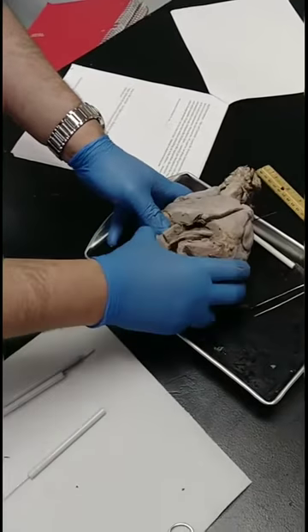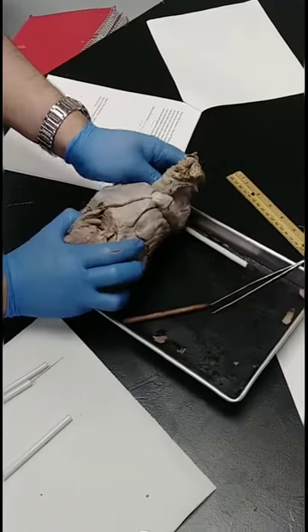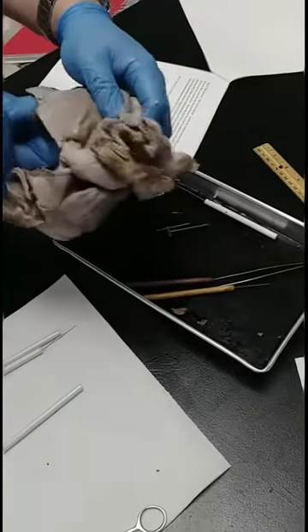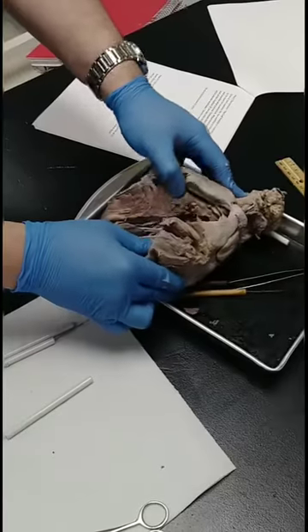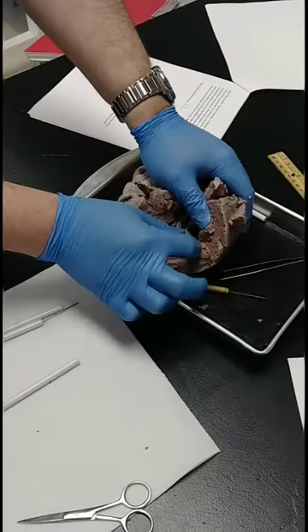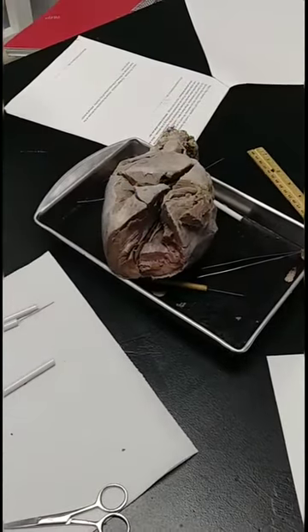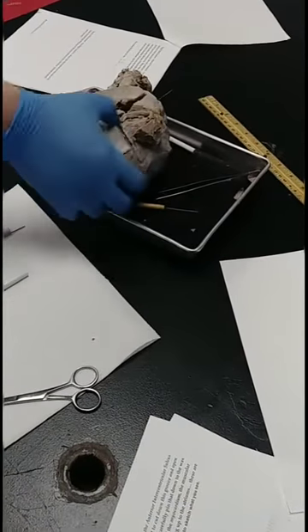That connects the right side and the left side of the heart up to this big trunk — the aortic trunk. With the probe, you can actually feel up there going up into the aorta, right here. Keep exploring that. This left ventricle — see how thick it is compared to the right ventricle. There's the apex of the heart down there.